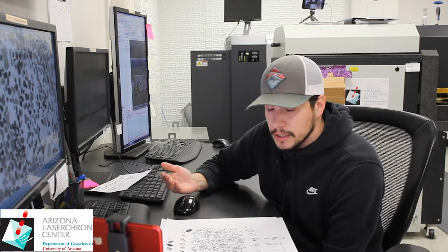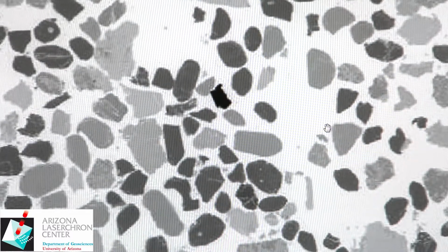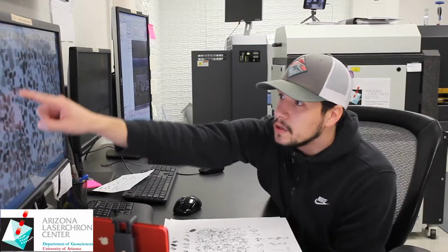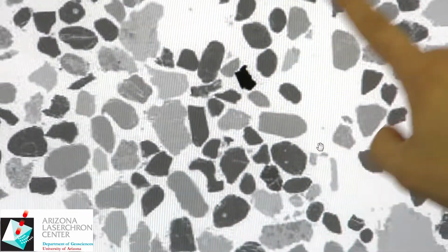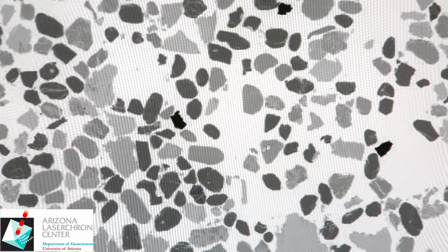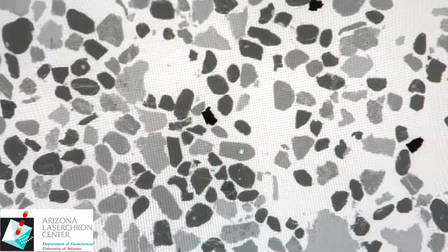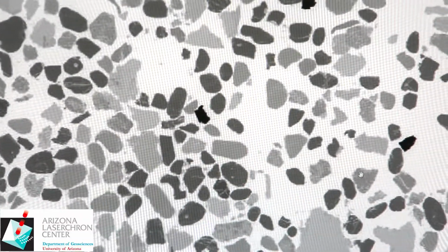So now the darker colors are the colors of the zircon, and the brighter colors are the non-zircon. So again, looking within that same region we were before, we can see that the darkest are those really bright barite pieces we saw in the non-inverted image. The zircon itself has a very similar dark gray response, while all the other non-zircons, the lighter minerals in these separates, are these light gray, verging close to white in their coloration.